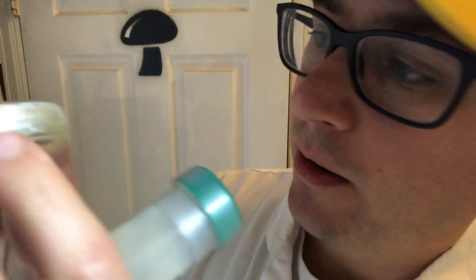You can see right here the mycelium is starting to come out from the edge of the plate. Luckily we have the parafilm, which will block it for a couple more weeks, but ideally I would want to switch this over to a new plate. This same Pleurotus species can be seen preferring to go deep into the slant to gather its nutrients.